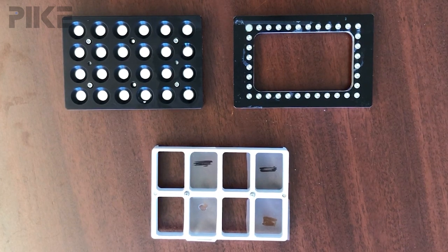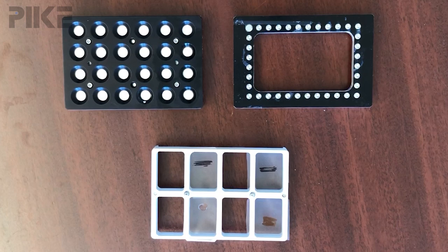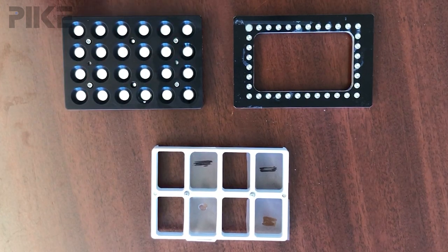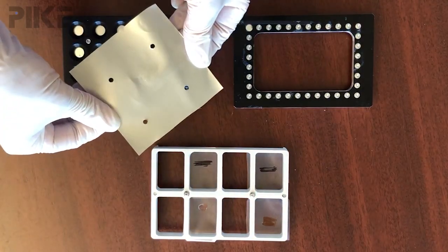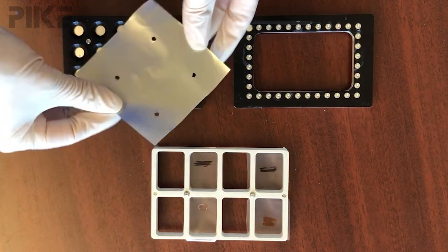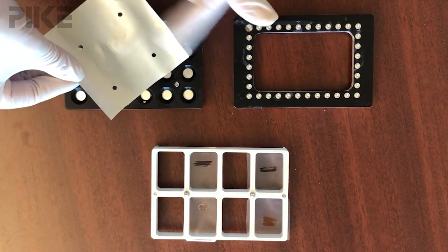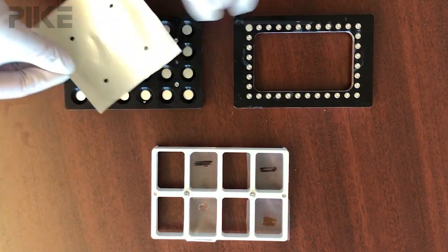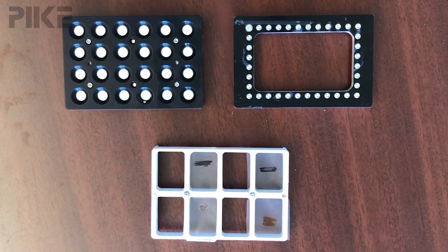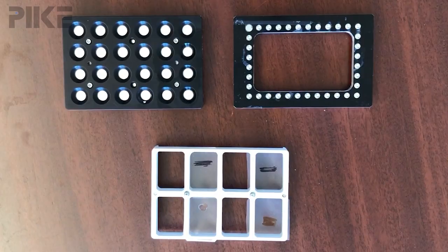The last plate is one I'm really excited about. I recently used this to map the surface of the inside of an aluminum can to see if the coating was uniform, and the structure of the plate helped hold that sample really flat.